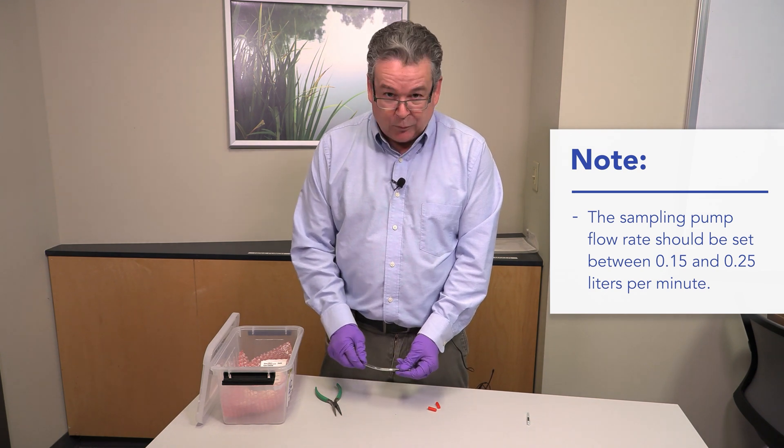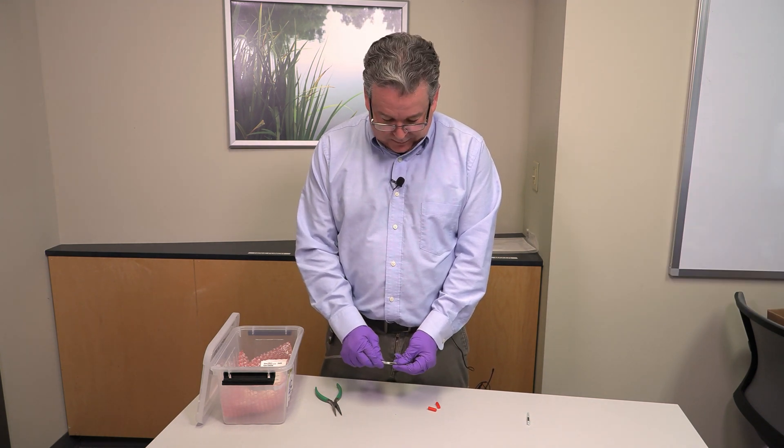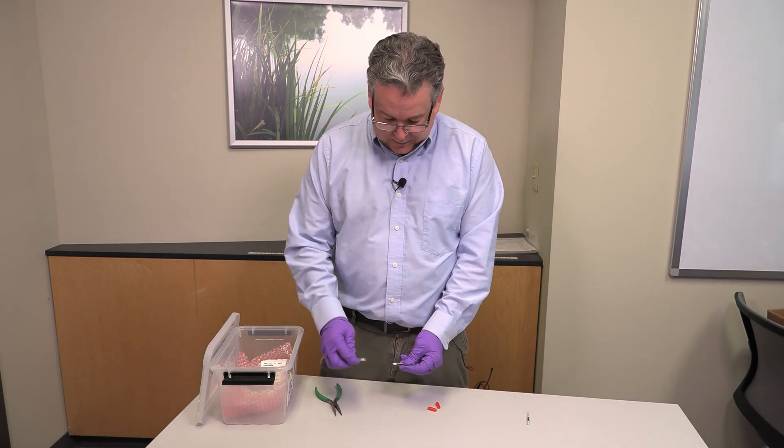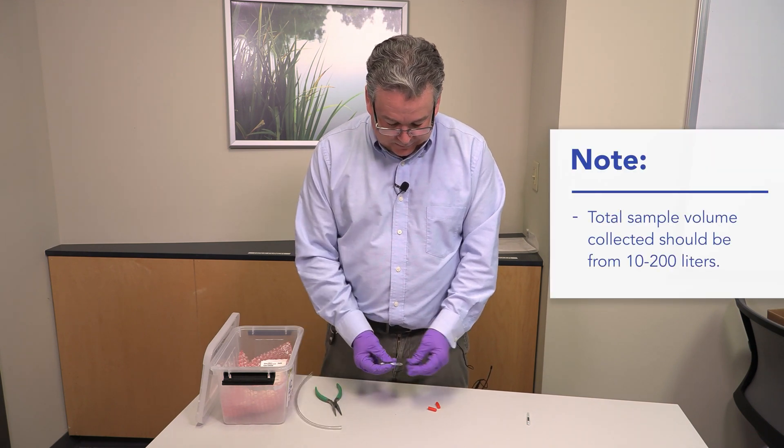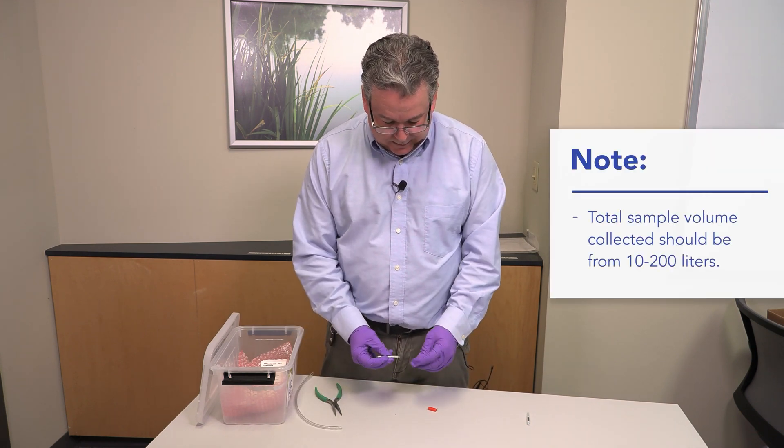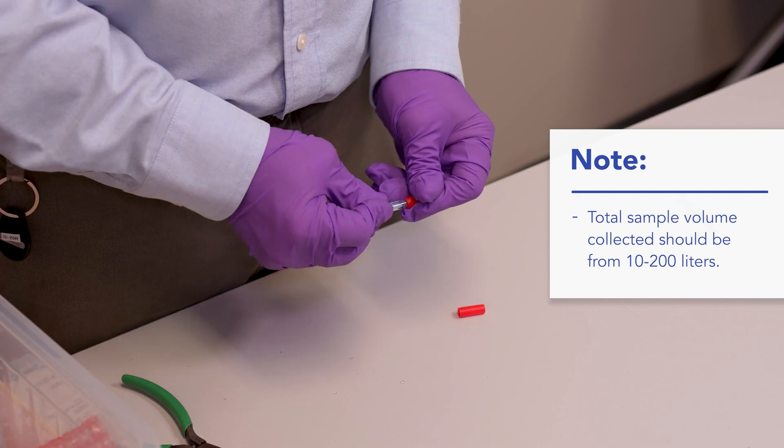Once your sampling event is done, whatever duration you need to collect the sample, you're going to disconnect the tube from the sampling pump. Then you reattach your plastic caps to protect the tube for shipment back to the laboratory.